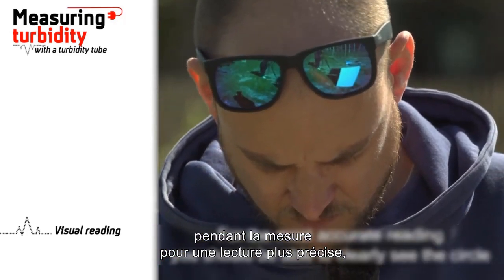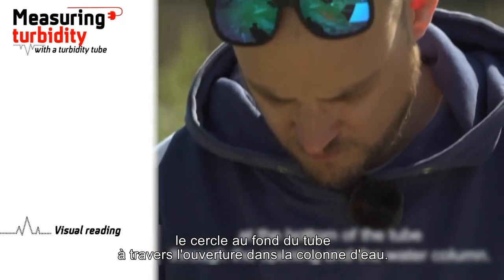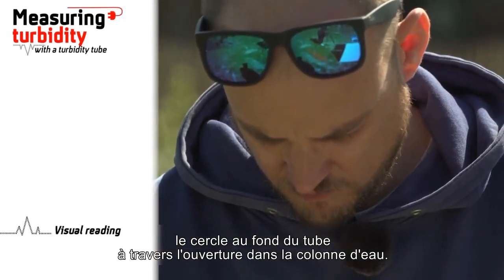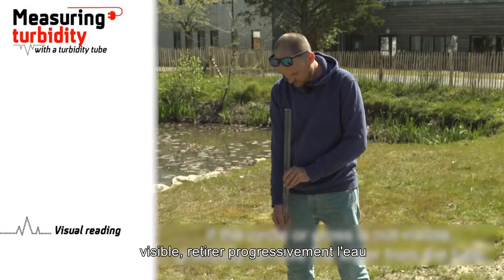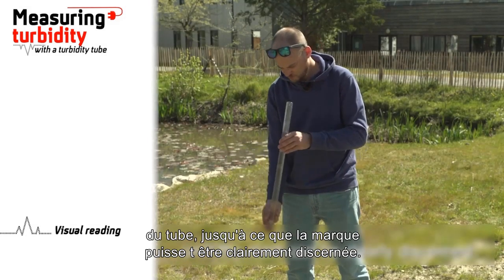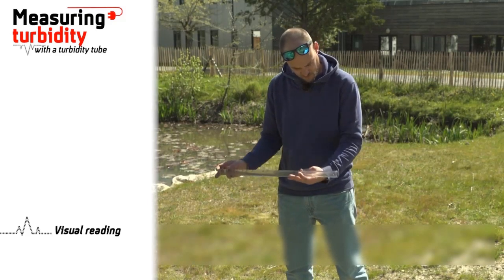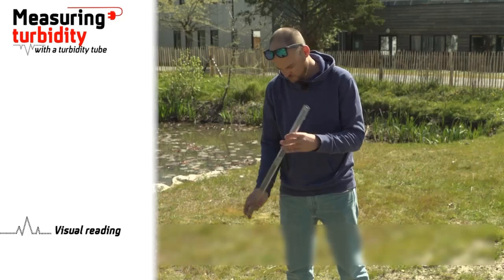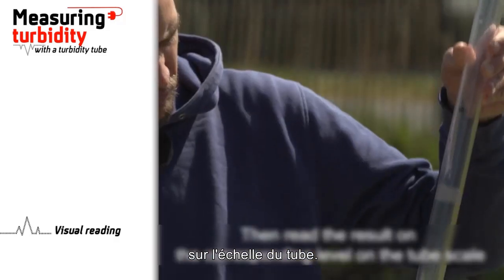For the most accurate reading, you should be able to clearly see the circle at the bottom of the tube through the opening in the water column. If the circle or cross is not visible, gradually remove the water from the tube until the mark can be clearly discerned. Then read the result on the corresponding level on the tube scale.